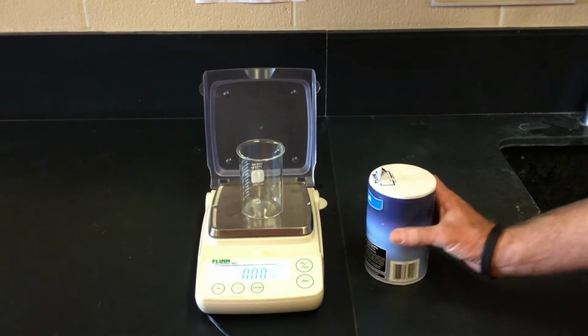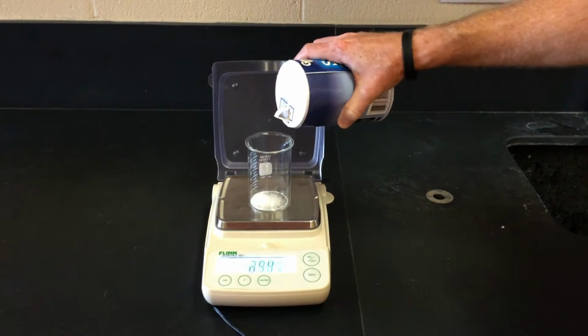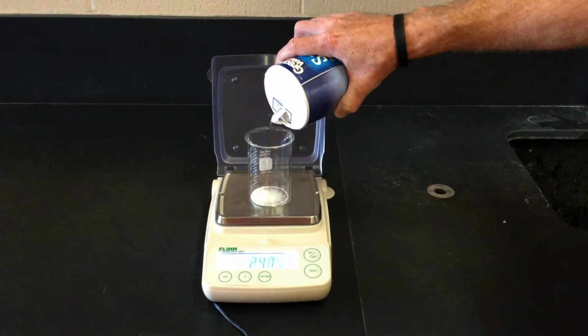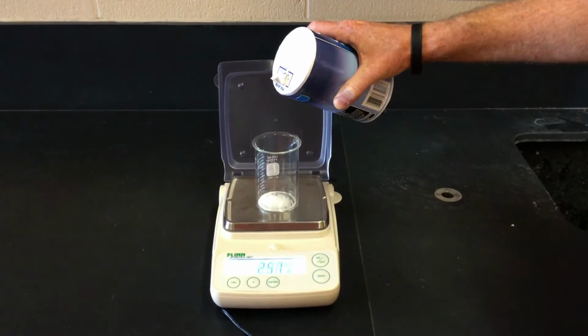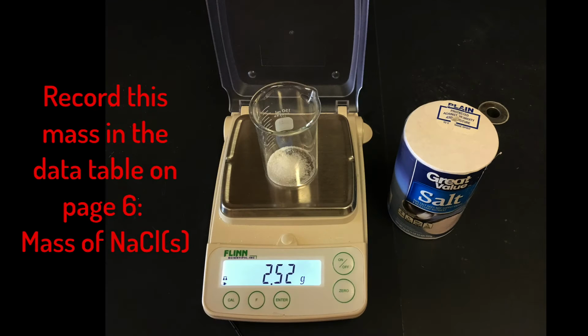Keep the beaker on the balance, hit the 0 button, and then add anywhere between 2.47 and 2.53 grams of sodium chloride. Record the amount that you added in the data table at the bottom of page 6, where it says mass of NaCl.